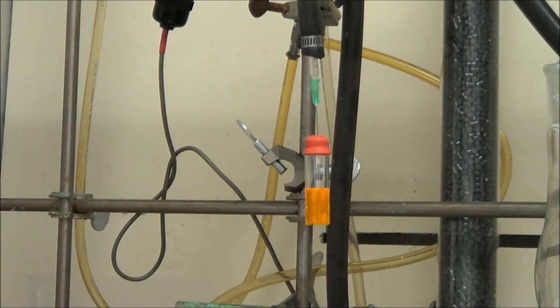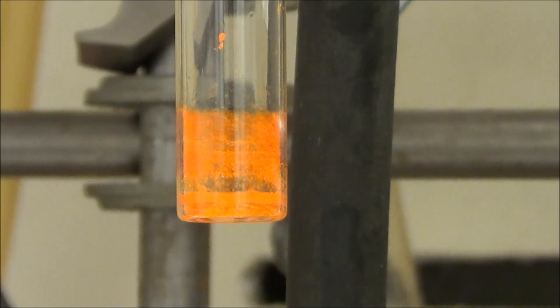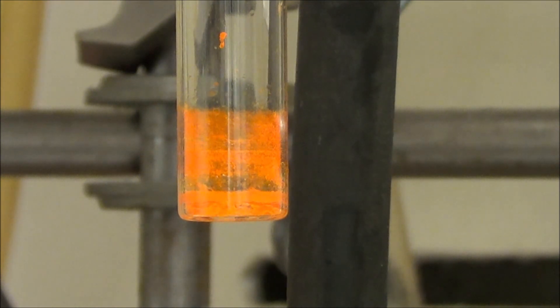Cadmium selenide gets the same treatment. Now I have to admit, this sample was unusual. It didn't bump at all. That's not normal, but I guess sometimes we get lucky. Here you see what it looks like after it's dry. You can see that the polymer is kind of crystalline and crusty, and it's embedded with quantum dots.